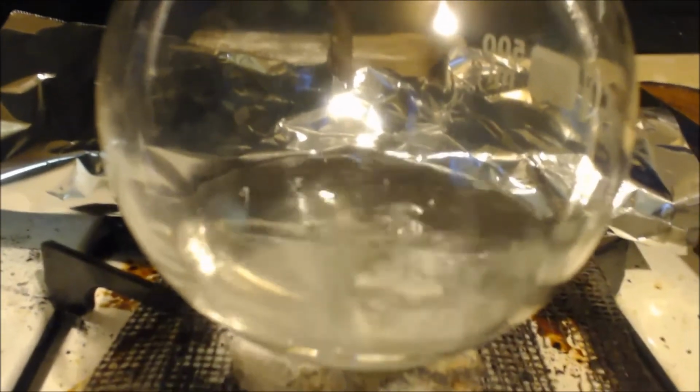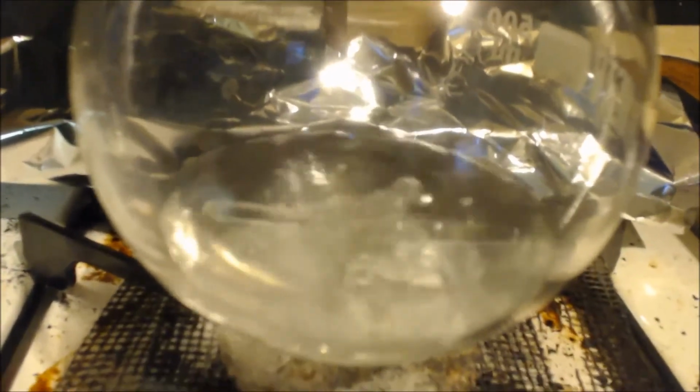Well, that's basically it. I'm just going to distill that over. That first little bit that comes over, I'm gonna discard. By discard, I mean put it in a bottle saying almost anhydrous, just in case there's a couple drops of water in there. And then everything after those first couple drops, bam, I will collect. Remember, don't distill your pot down to dryness. Leave something in there. Those first couple milliliters that you distilled over, you can mix it with this pot and save it.